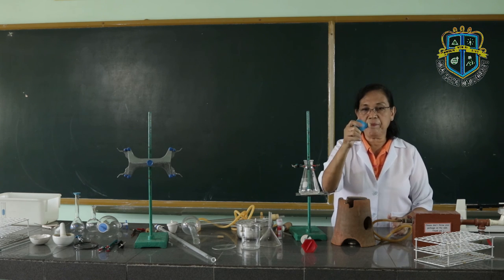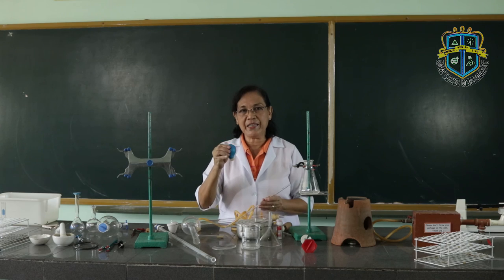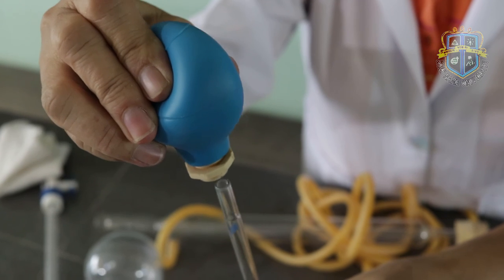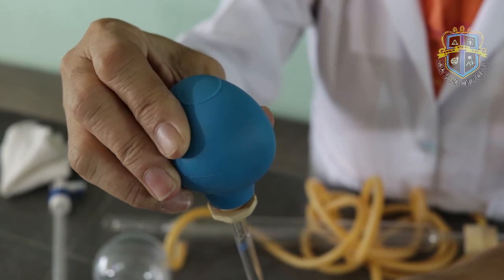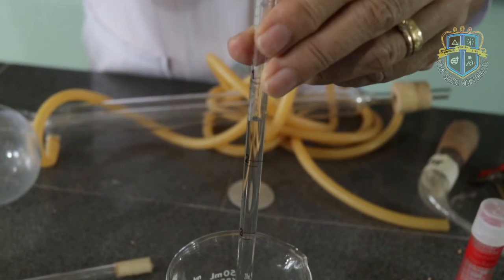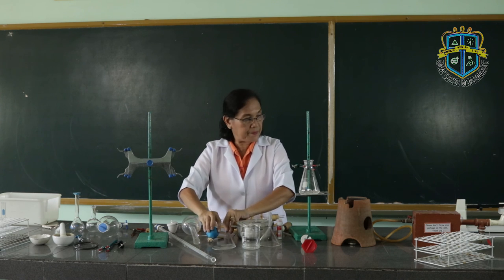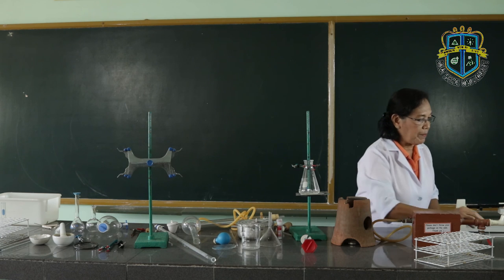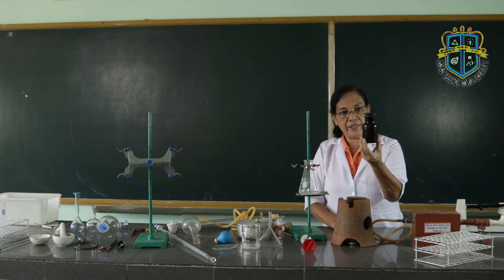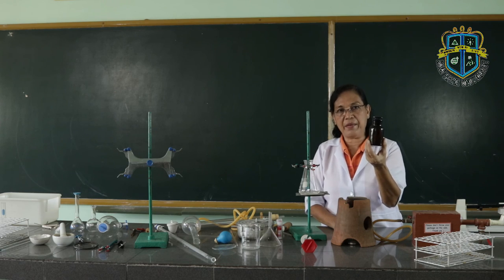This is what we call the pipetor. The pipetor is used to aid in pipetting a substance through the pipette — you use it this way. Then, last but not least, we have the reagent bottle. The reagent bottle is used to contain reagents or chemicals.